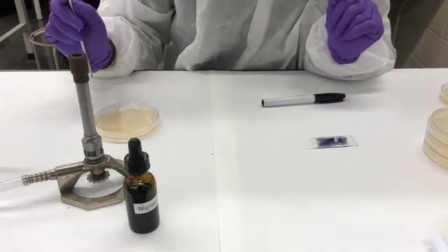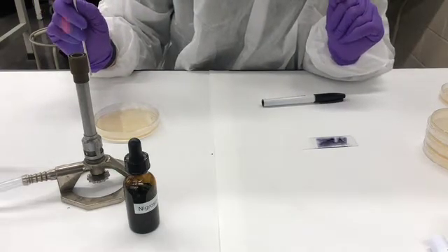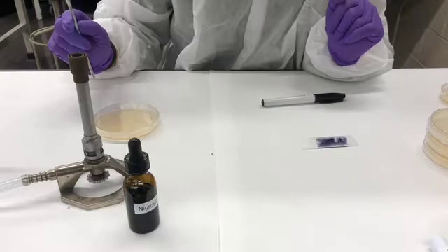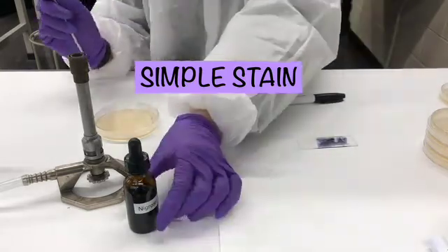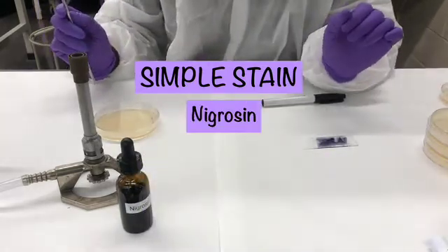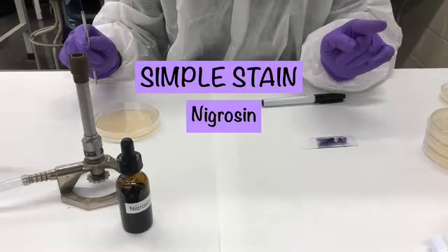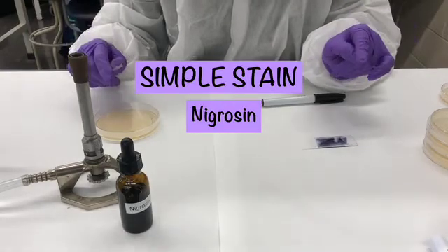Today we're going to be doing another simple stain. This is a stain called nigrosine. However, it is not a direct stain like we learned last week with methylene blue.